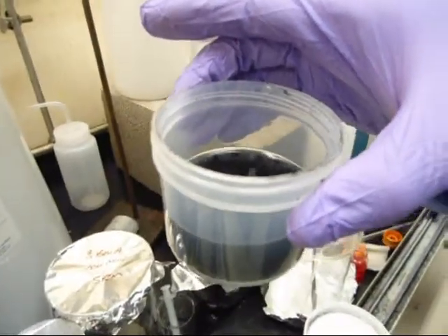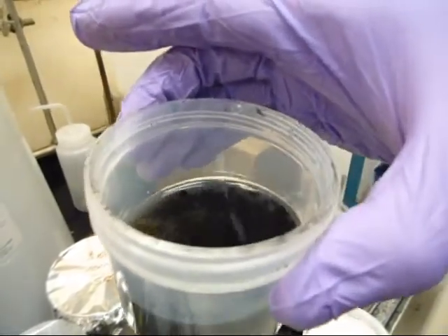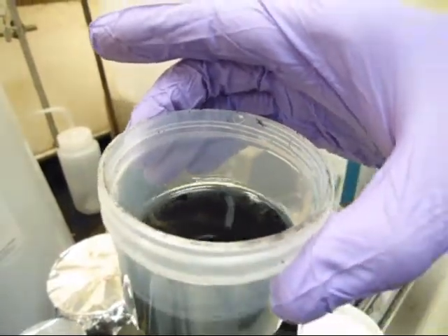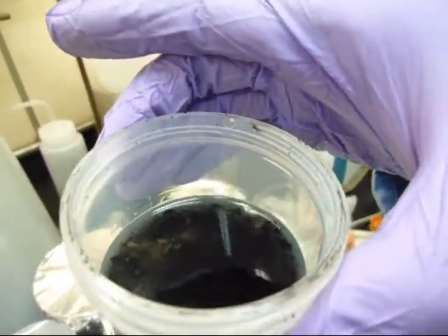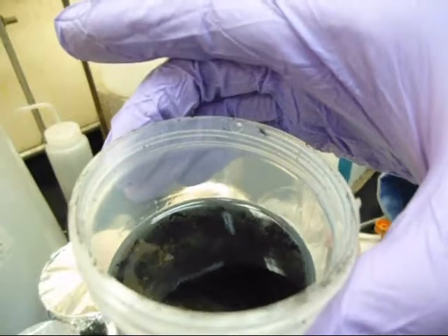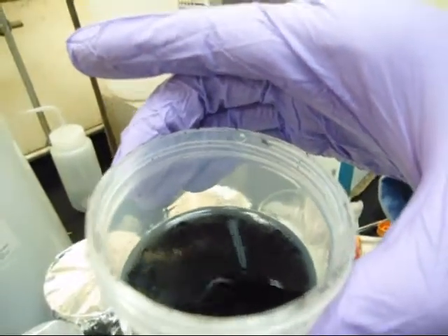After one day, as you can see, the rubber pellets have been well dissolved in THF. However, the graphite powder is not well dispersed. It forms large chunks.